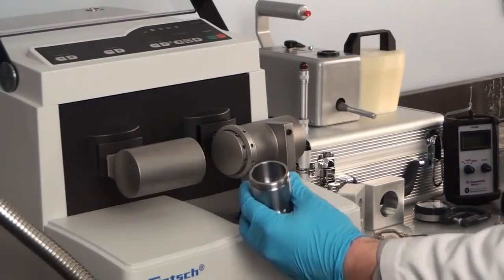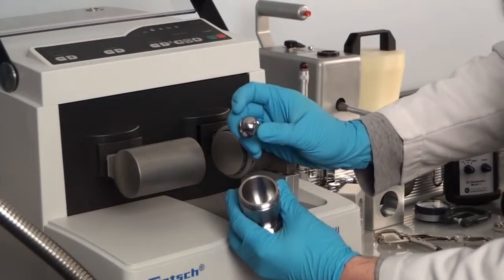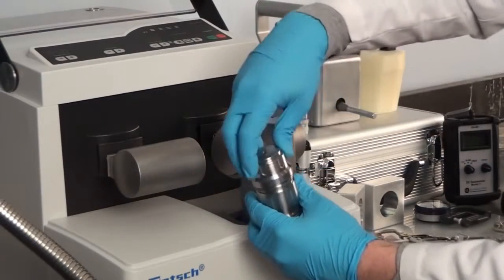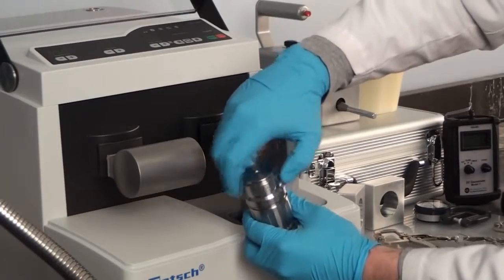Here's one of our technicians introducing a plastic substrate along with a ball bearing into the stainless steel vessel to pulverize your sample.